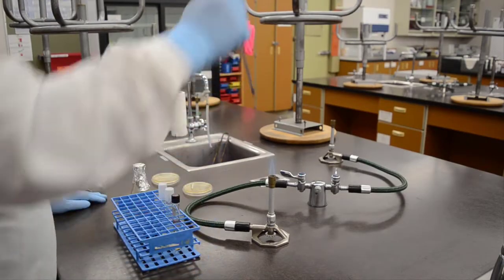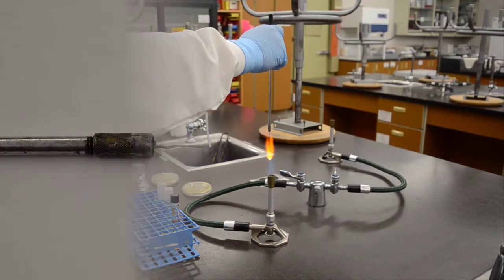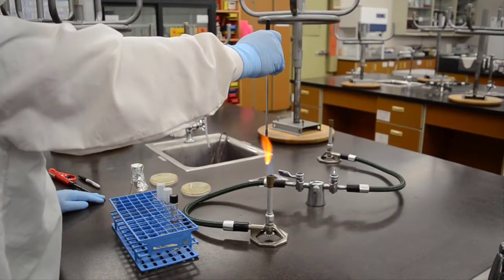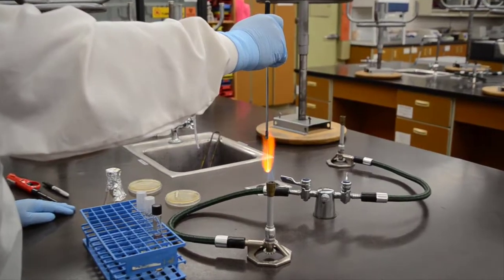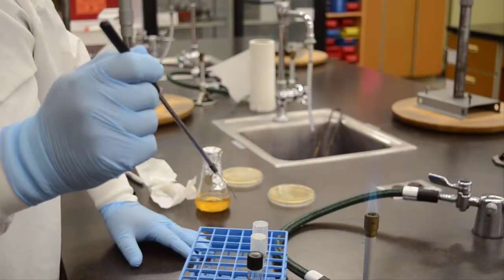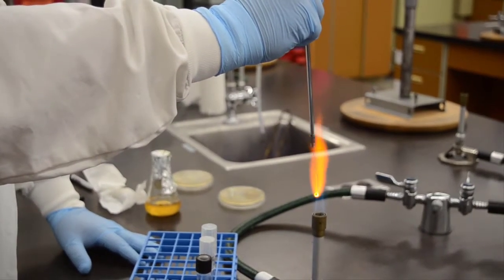The next thing you'll want to do is flame your inoculating loop. This sterilizes it by incineration. This is a loop. You can see it has a smooth loop at the end which holds a droplet of inoculum with living bacteria in it. When you flame your loop, you want to do it as vertically as possible and get as much of that wire glowing at the same time as you can. Here's another example of that before we do an inoculation.